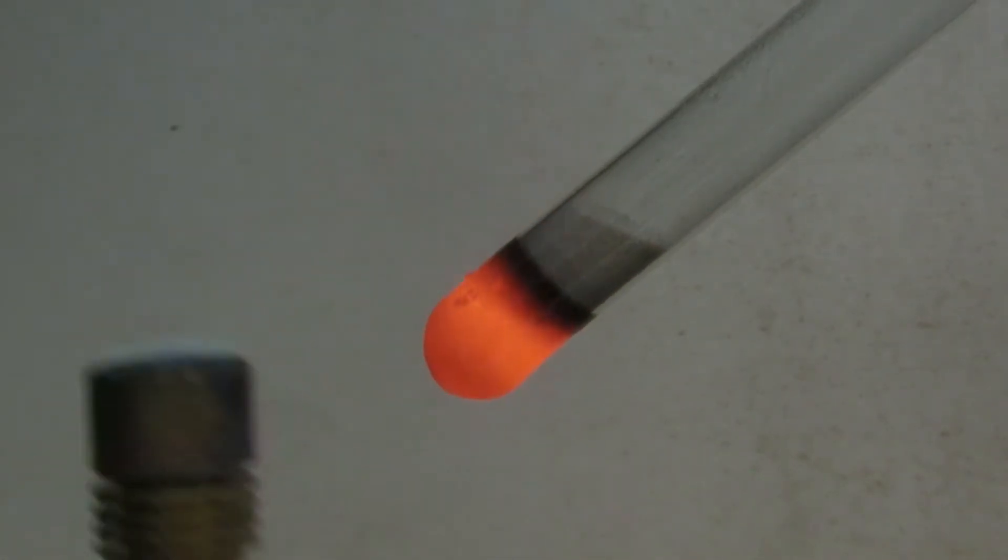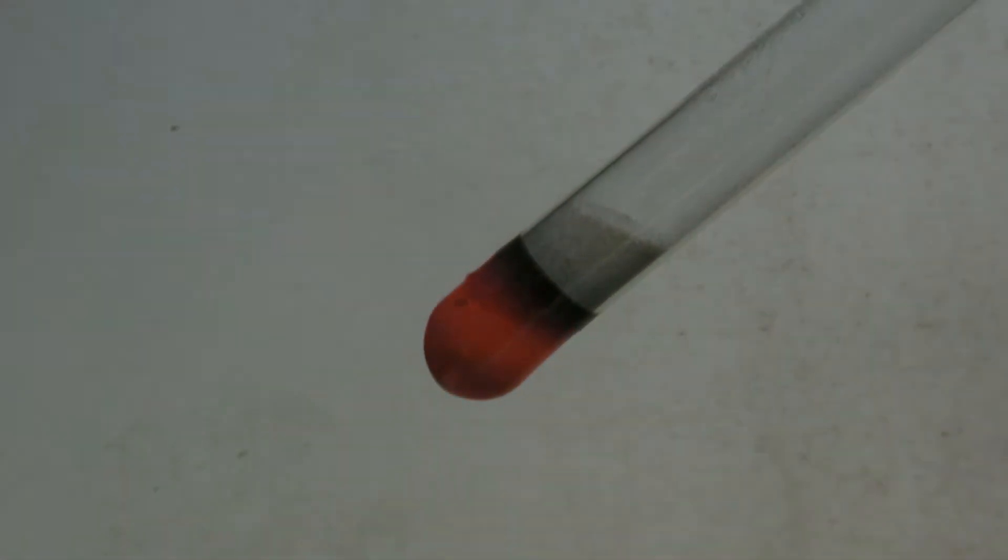When the reaction is finished the tube is left to cool. While cooling the tube gets many cracks but usually these don't cause the tube to fall apart.